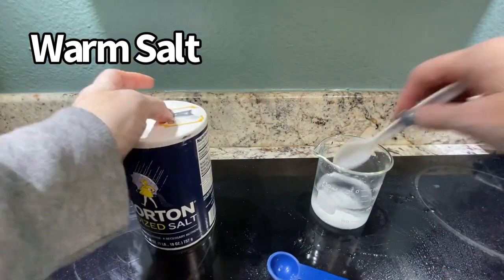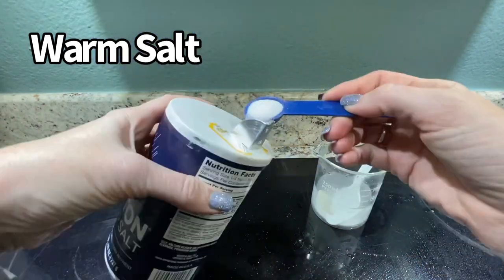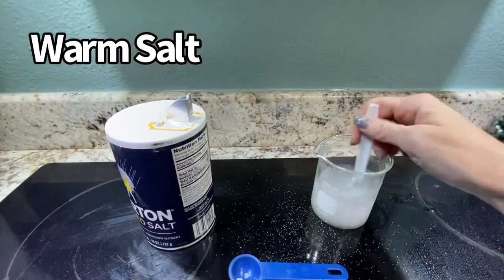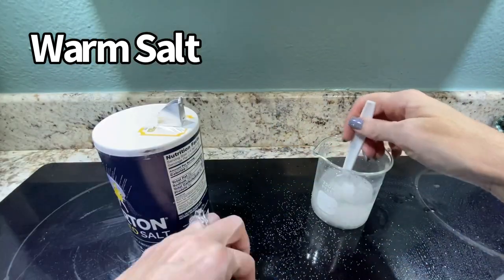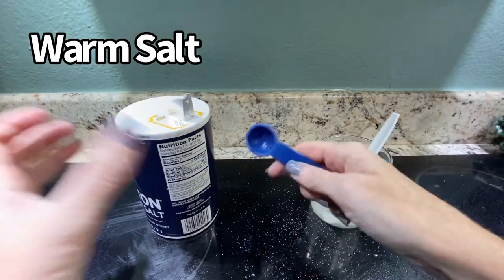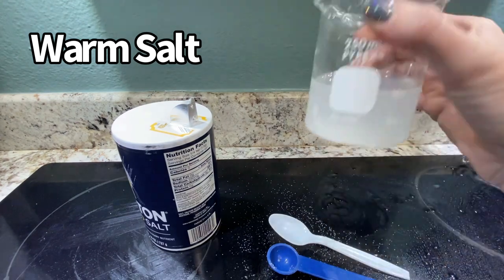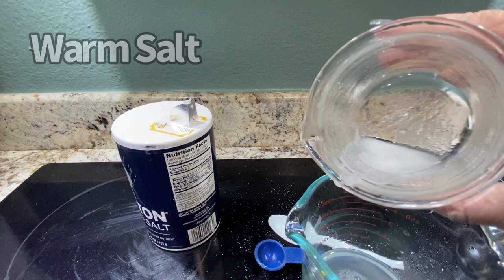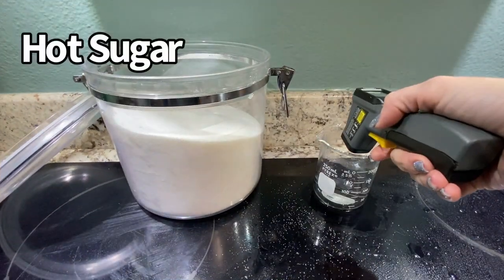Now we're at 76 degrees Fahrenheit for salt: 10, 15, 20, 25, 30, 35 milliliters in our warm water. You can see that a few of those final milliliters were saturated and didn't dissolve very well.